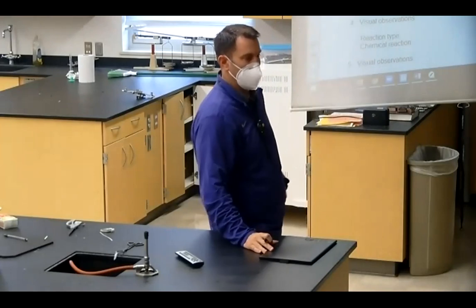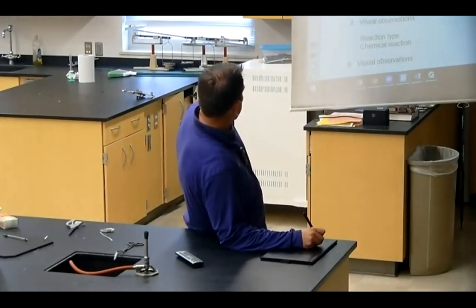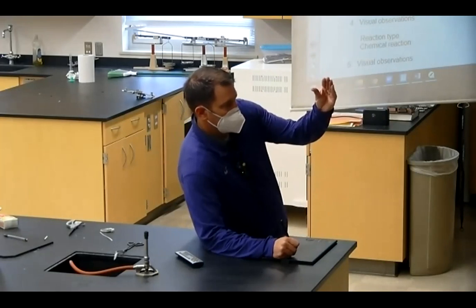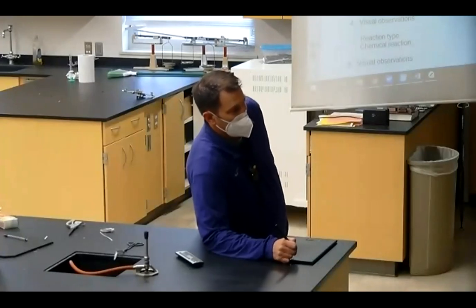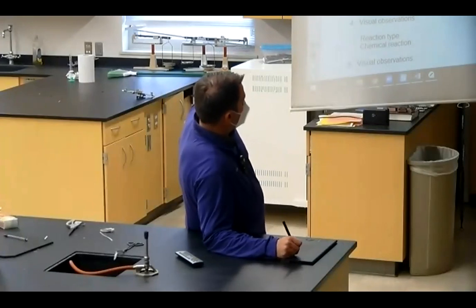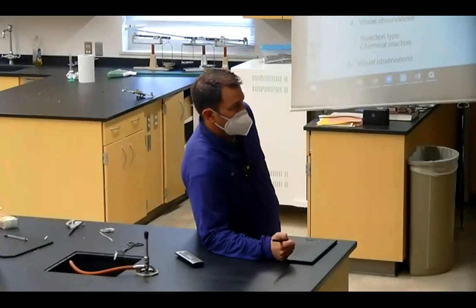Okay, so that noise you could hear was this wood burning in a pretty tight test tube, and it was forcing stuff out of the back, mostly the burning wood fumes. So carbon dioxide, water, and other things were coming out the back. So what we sort of made right here was a rocket.